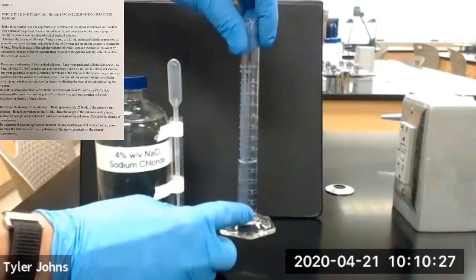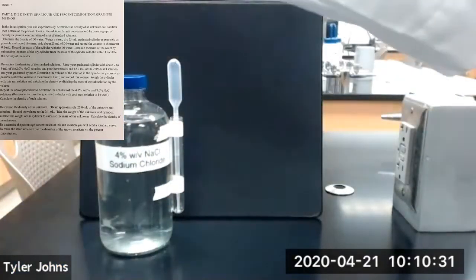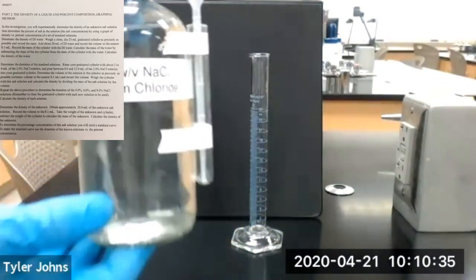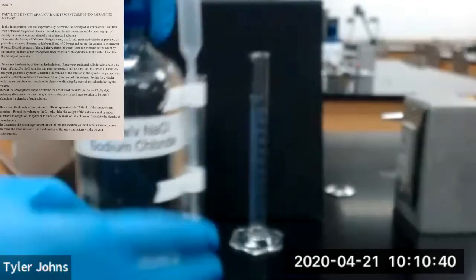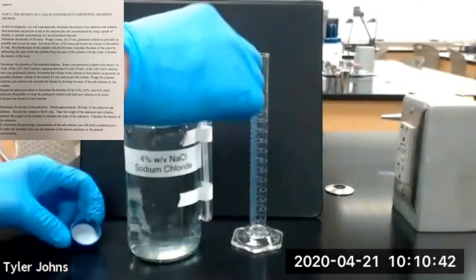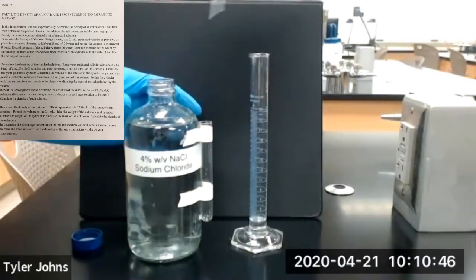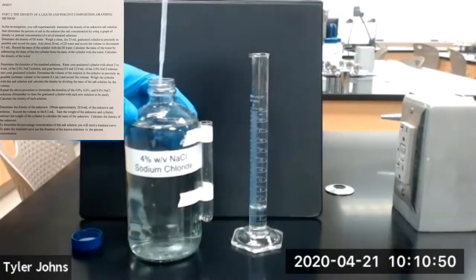Okay, so we're going to dump our 2% salt solution. And the next standard salt solution we'll be using is 4% sodium chloride. So we're going to rinse our graduated cylinder with a couple milliliters of this 4% sodium chloride solution.